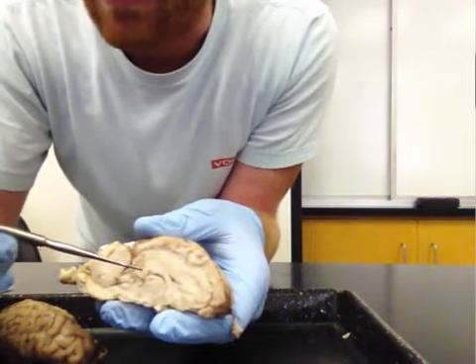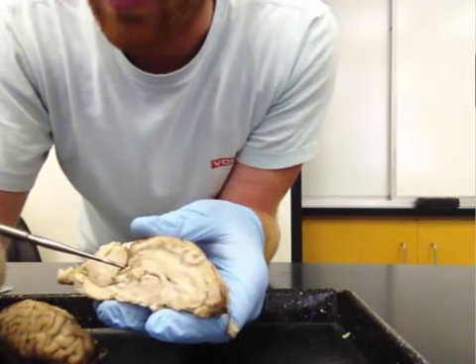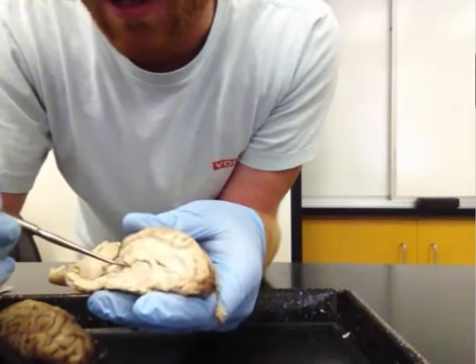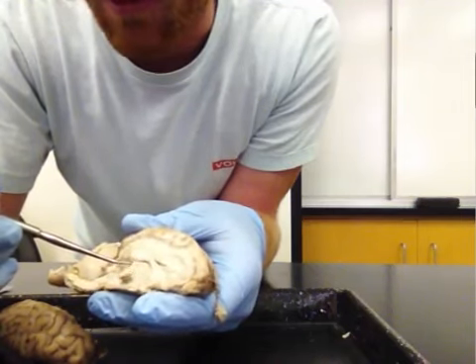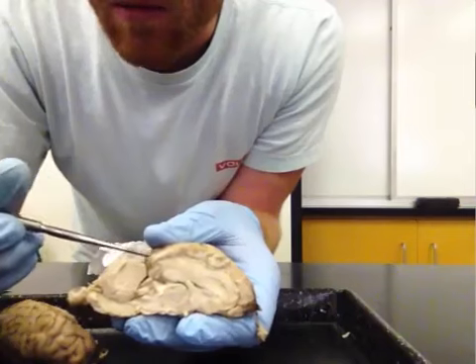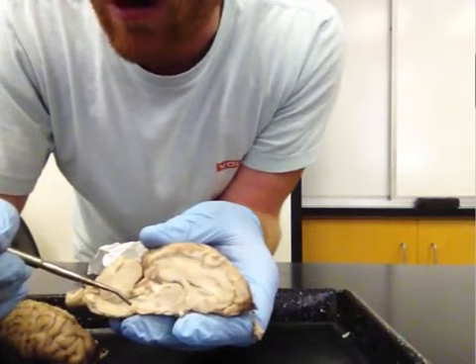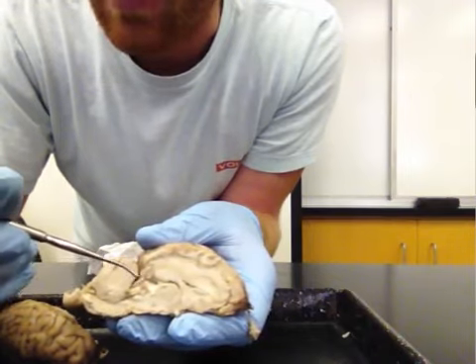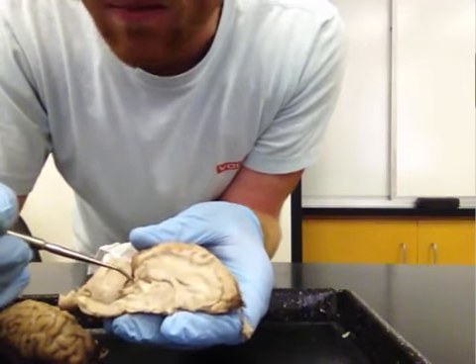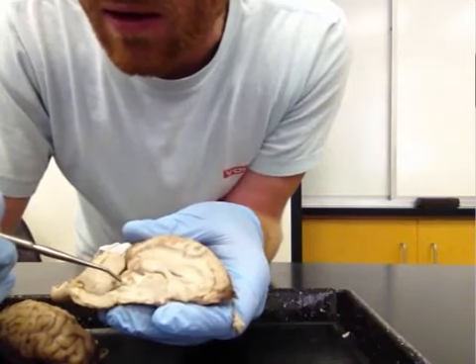And Descartes actually thought that this was the seat of the mind right here because there's actually only one pineal body in the brain, unlike most of the structures that we'll see. And you can see that the pineal body, you can actually just remove this all the way from the brain there, this little sphere. Then some other parts of the brain that we couldn't see before. We saw the pons and medulla brainstem, but now we can actually visualize some of the midbrain brainstem. This includes the superior colliculus. Then just below the superior colliculus, we have inferior colliculus.